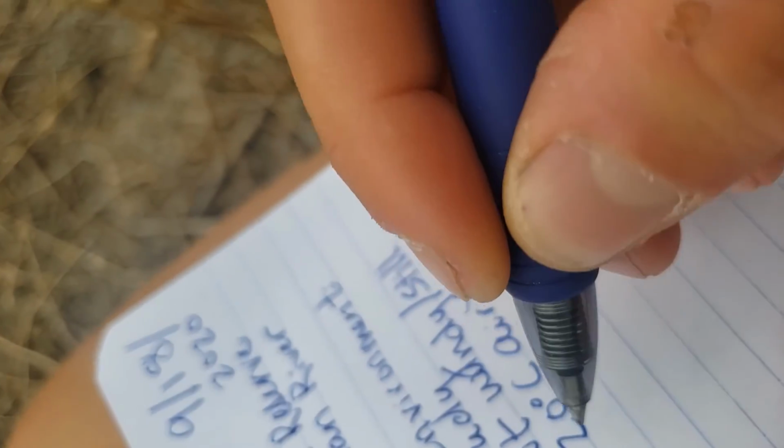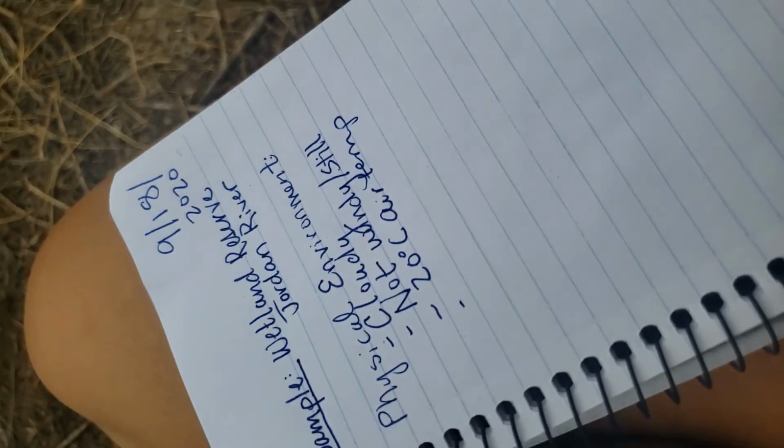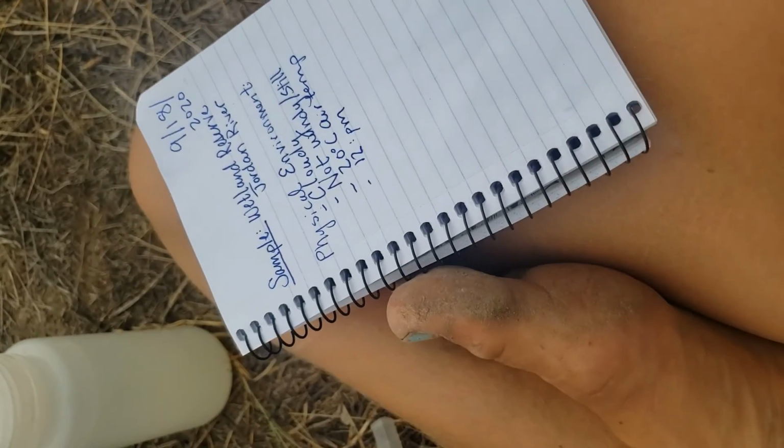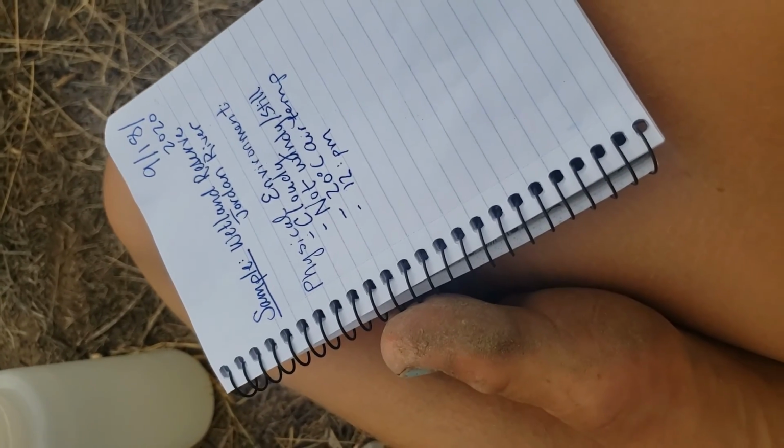And the time of day, so it's about noon. So I'll do 12 p.m. Okay. All right, now we're ready to start testing the water.